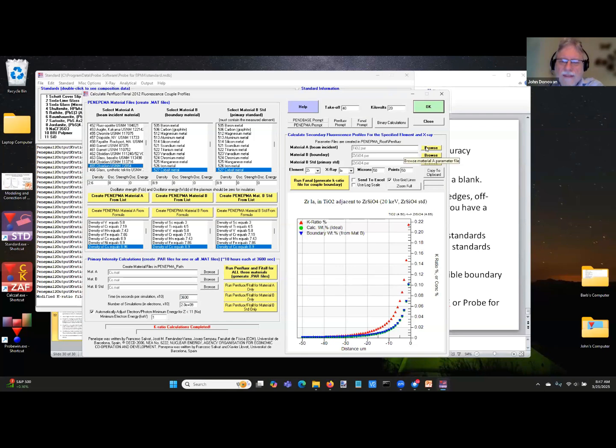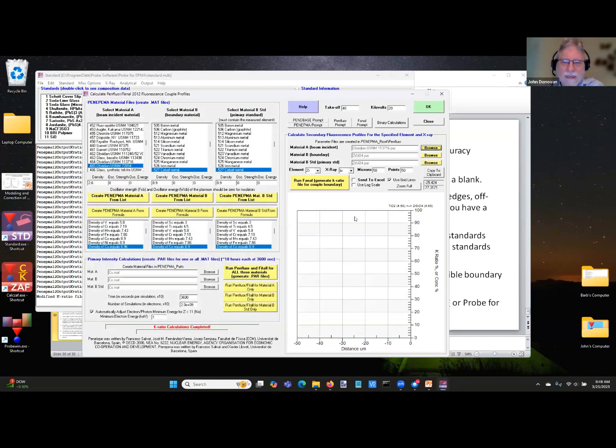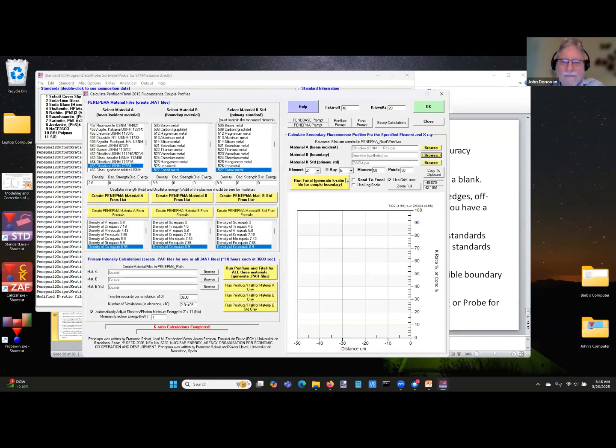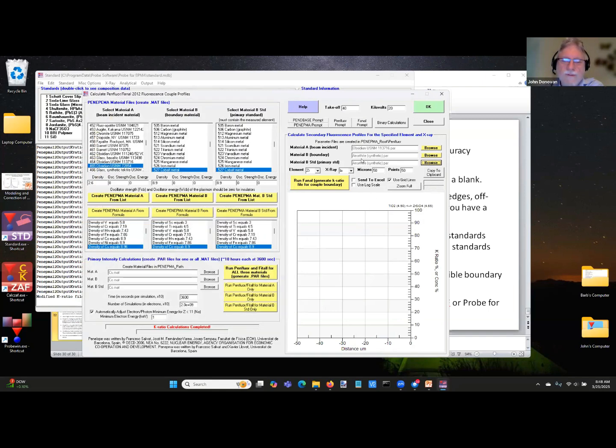So if we look at calcium, whoops, I clicked the wrong button, sorry. If we look at say calcium in obsidian, let's see. Well, here's an obsidian, and then we look at it adjacent to a calcium-bearing phase, which could be anorthite, and we're just using anorthite as our primary standard. You have to have a primary standard, the one you're actually going to use.